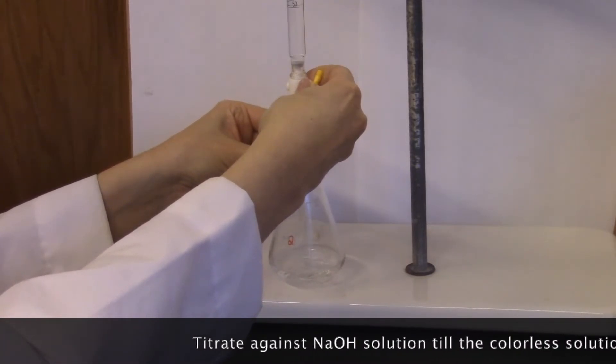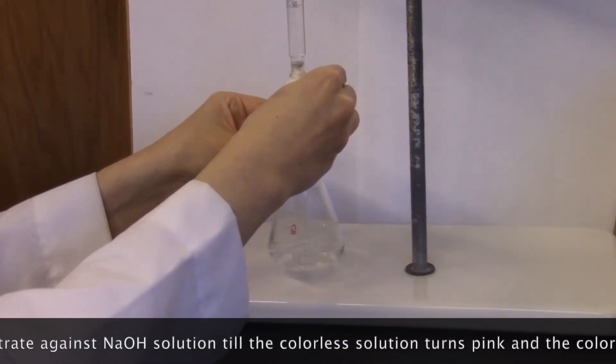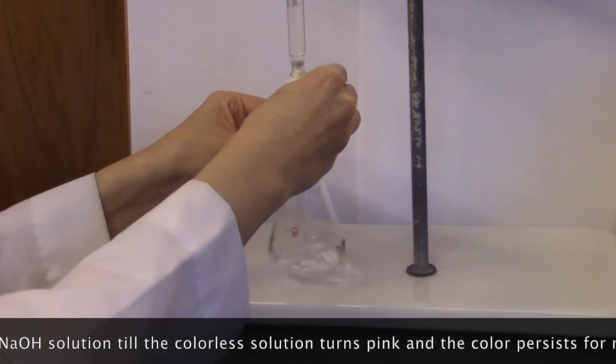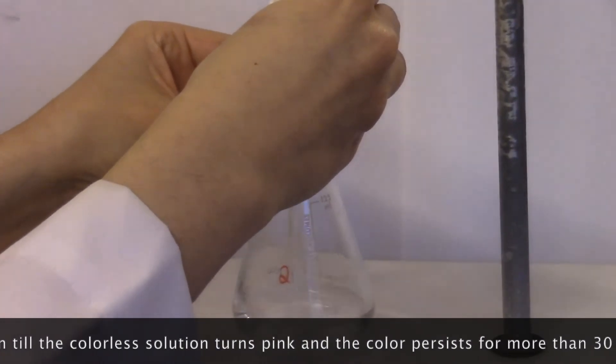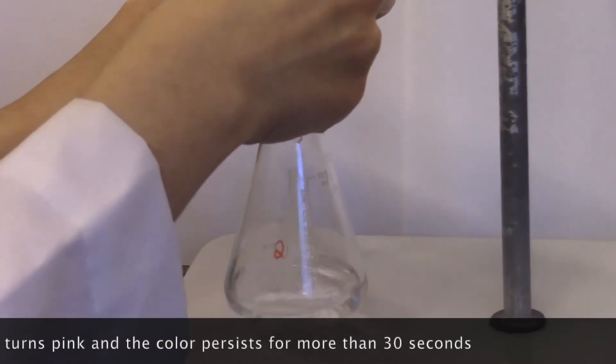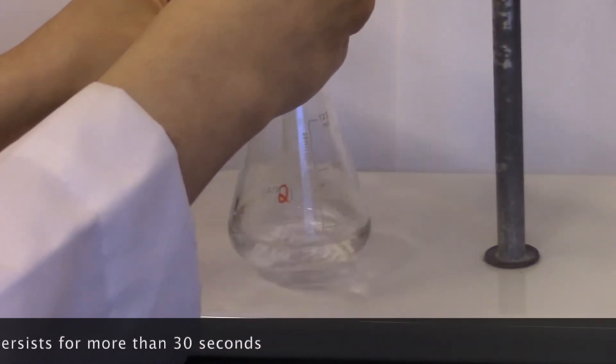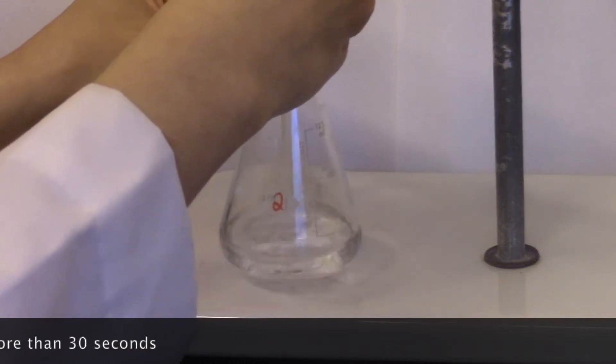Add sodium hydroxide solution from the buret.